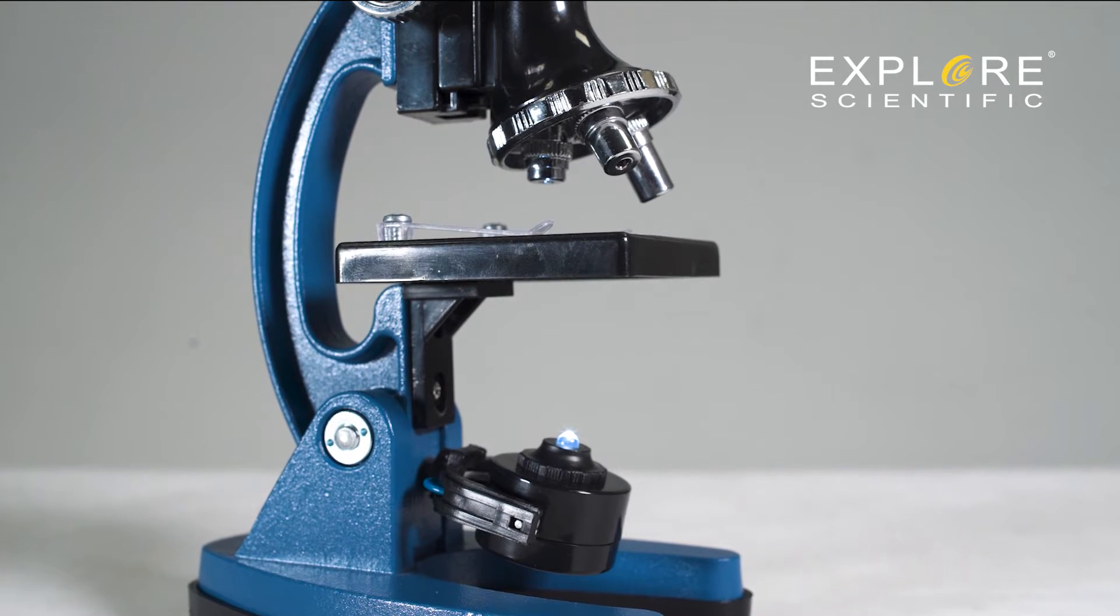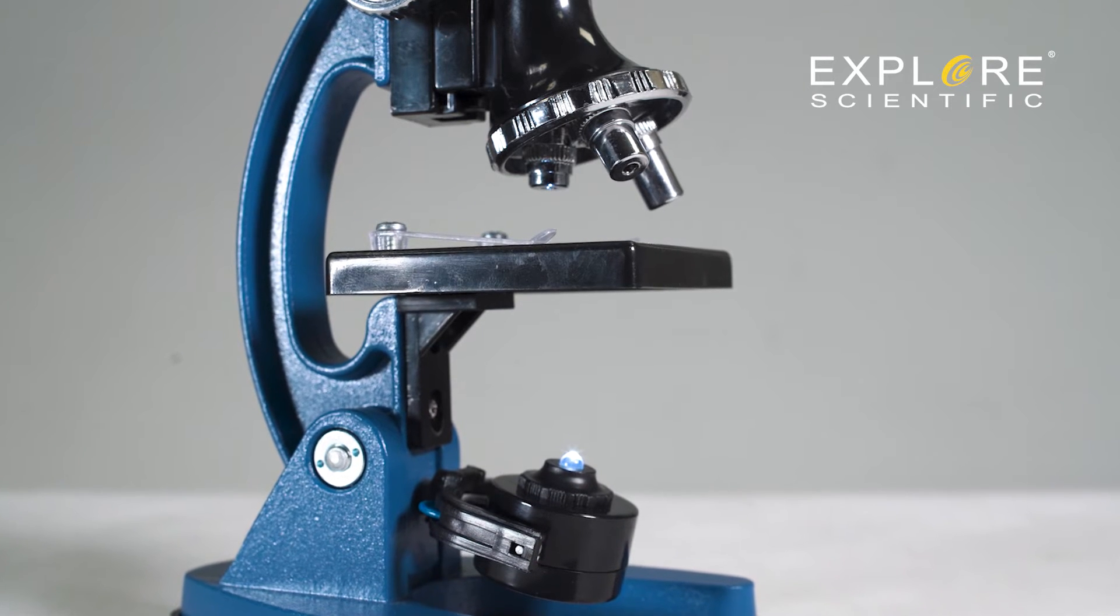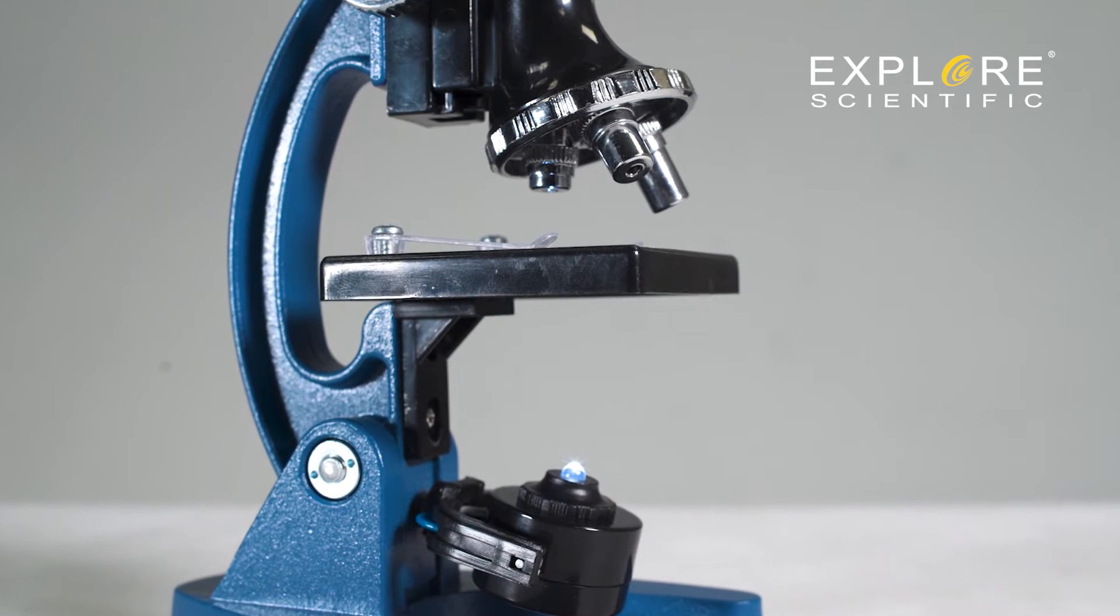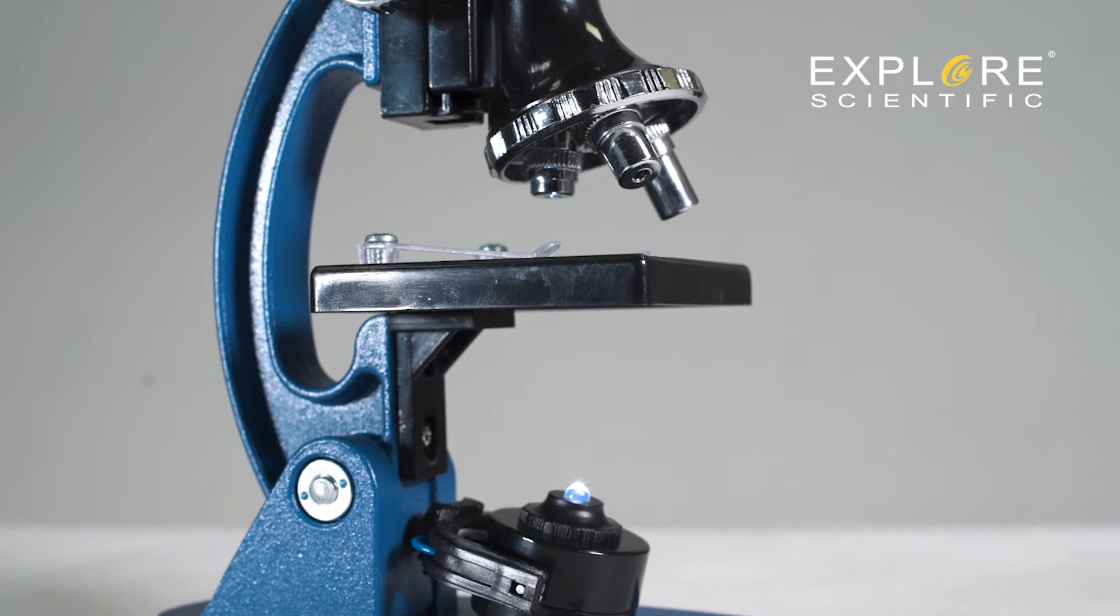The stage is where the slide is inserted or specimens are placed. In this model, you will see two clips that hold the slide in place. It might be difficult at first to place a slide under the clips.